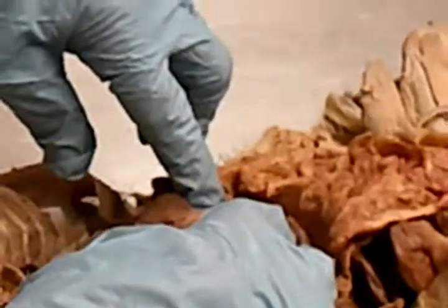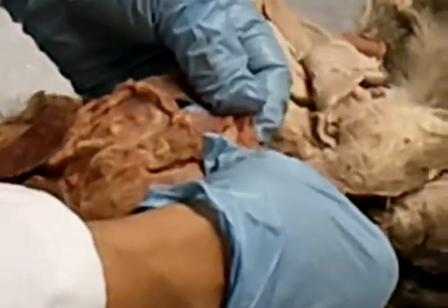And then the reason we can't see all the loops of the small intestine, we're going to go through this, but there's a structure called the greater omentum. It's one of the mesenteries. We're going to go through an exercise on mesenteries, and I'll explain all about this. But this greater omentum comes off the inferior anterior border of the stomach, and then when it goes back down, it actually comes back to attach to the colon. And it acts as an apron. That's what the Greek term omentum means.